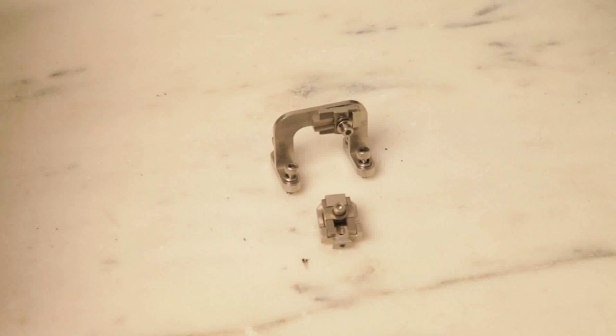This TA Tech Tip is going to show you how to calibrate Q800 film tension clamp. Before calibration, we shall first install the clamp to the instrument.